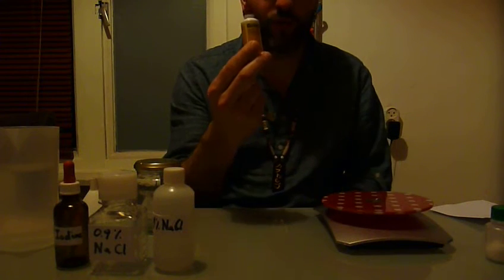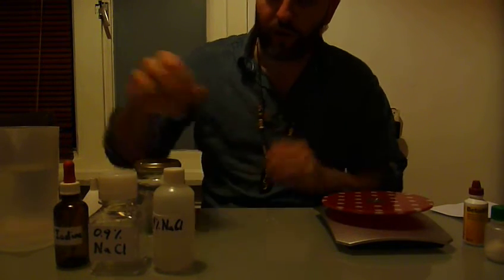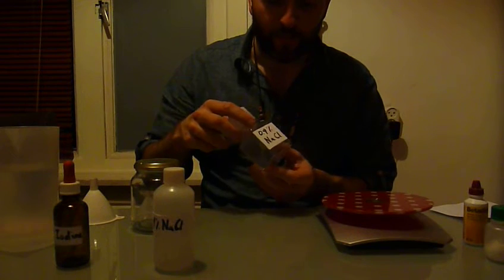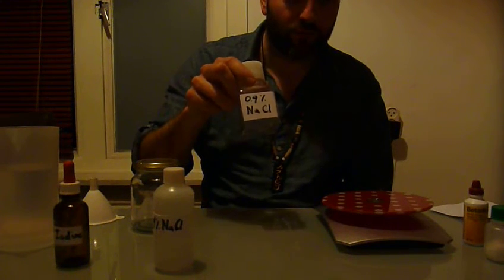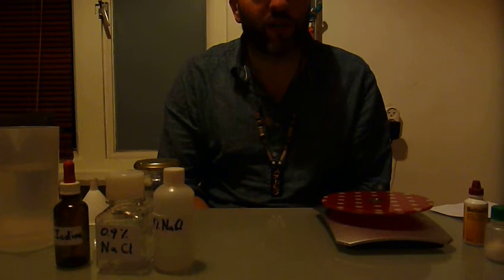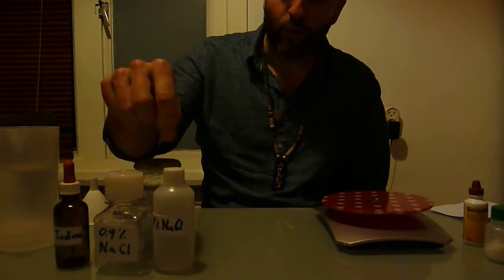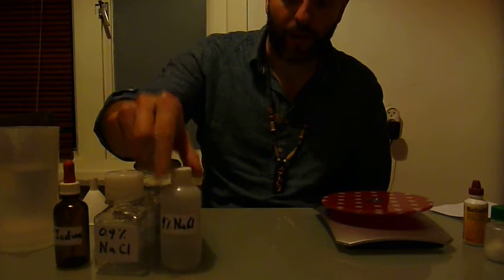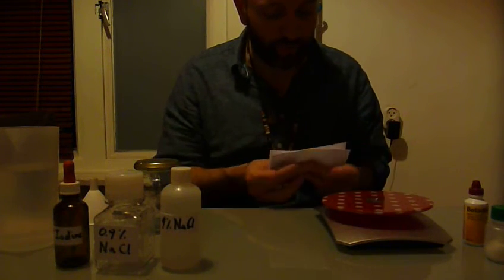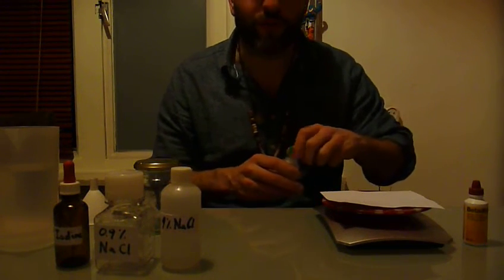So we're going to eventually have to dilute this one 10 times to get to the 1%. We'll start out with making the saline solution, because that's also going to be the basis of the iodine solution. So first we're going to make a 0.9% solution of sodium chloride. For that we would ideally weigh 0.9 grams and put it in 100 milliliters of water, but as our scale cannot measure that, we will first make a 9% solution. We take a piece of paper and fold it, which makes it easier to pour out later, and you measure 9 grams of sodium chloride.